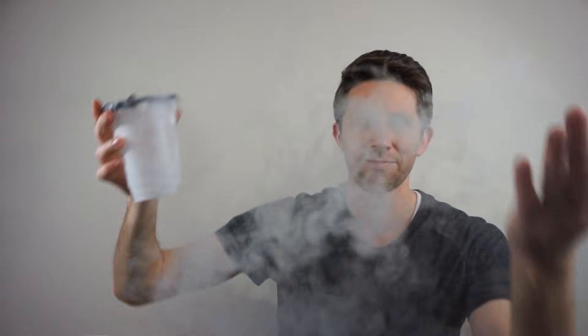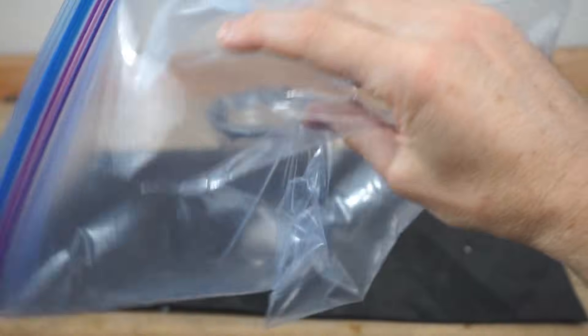Okay, today I'm going to be showing you how you can make liquid air and even liquid oxygen with just a bag, a test tube, and some liquid nitrogen. So today I'm going to be turning this bag of air into a liquid.